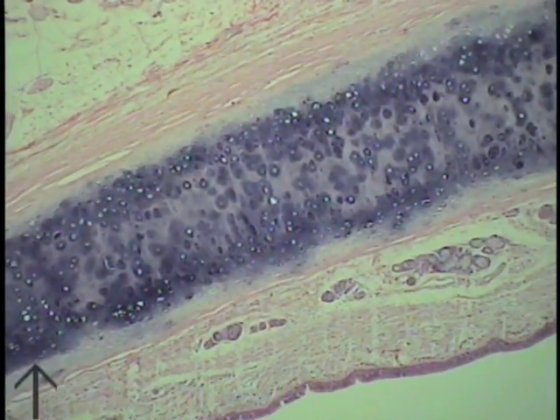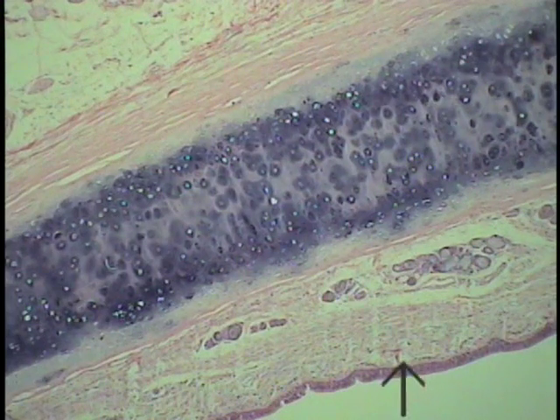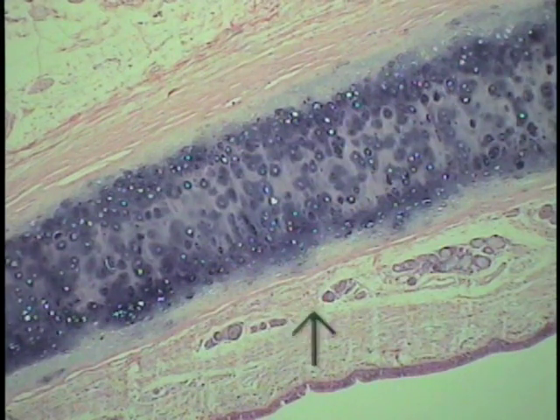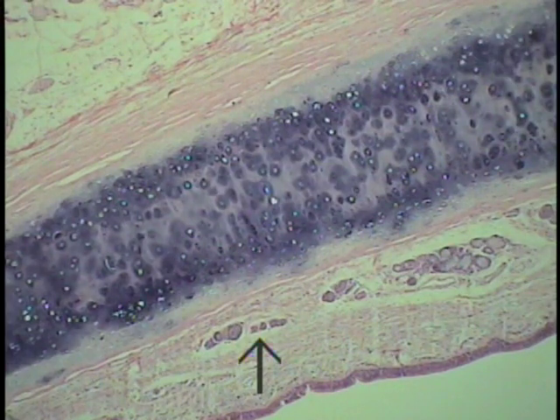At this particular angle, we can see all the layers: the respiratory epithelium and its basement membrane, a lamina propria area of felt-like connective tissue, and then, if this is the avenue that's chosen, coarser, wider bore connective tissues that are yet open and house the tracheal glands, being the submucosa.